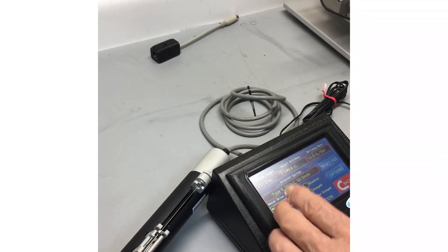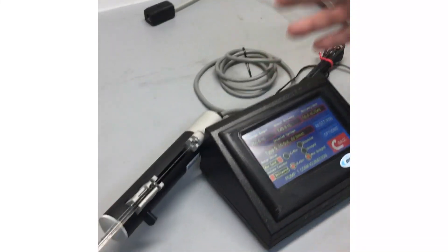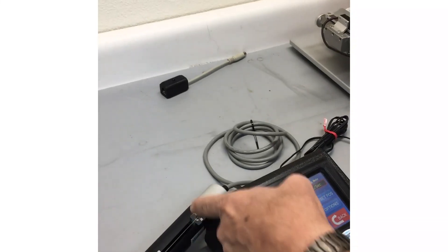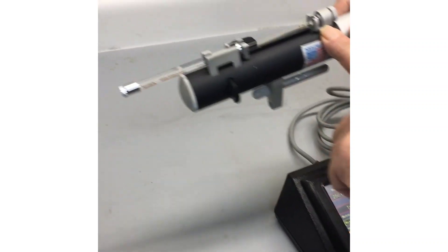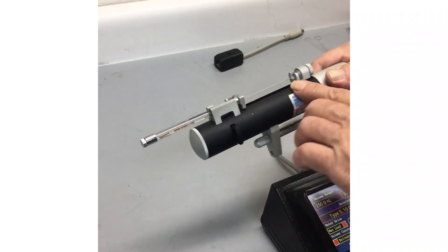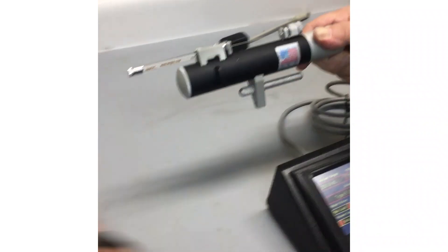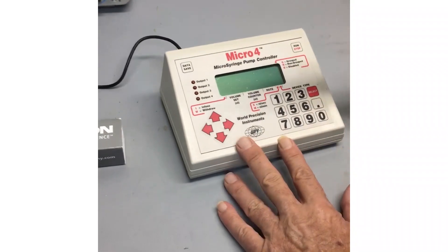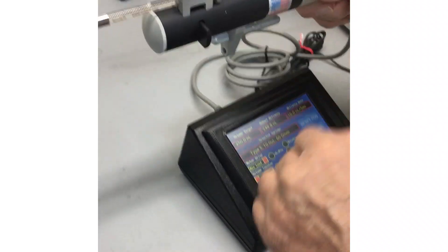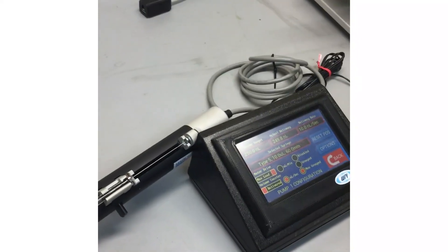The main thing is that this is only set up for one syringe. I can't go move this over to channel two and set it up for a five microliter syringe, because this location is going to move. Basically right now I'm at some digital count stored in here. If I go move this to channel two and move this up, then go back to channel one, the machine still thinks it's here — a lot of people are doing this by mistake. This has to know exactly where this is. So if you're going to swap over to a five microliter syringe, you get to start over from scratch — you just can't swap back and forth. That's the way this works.